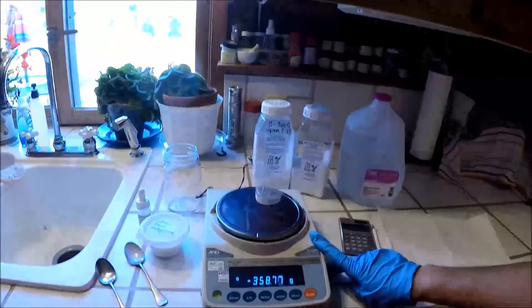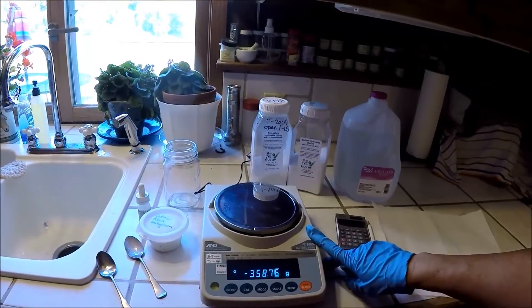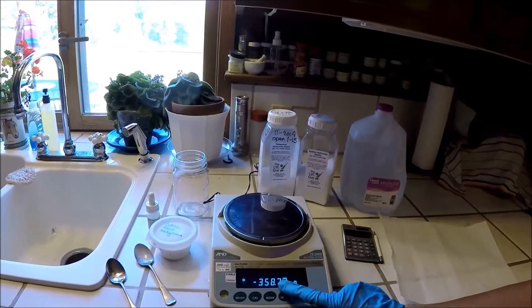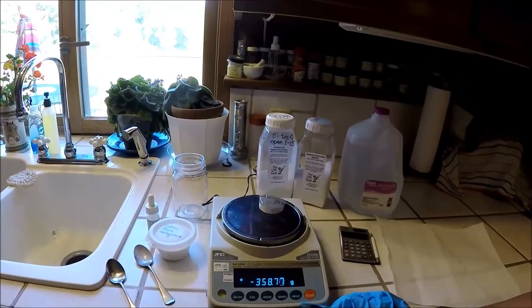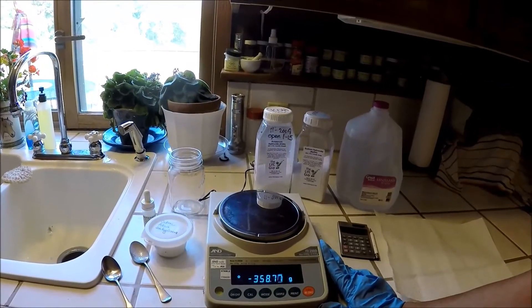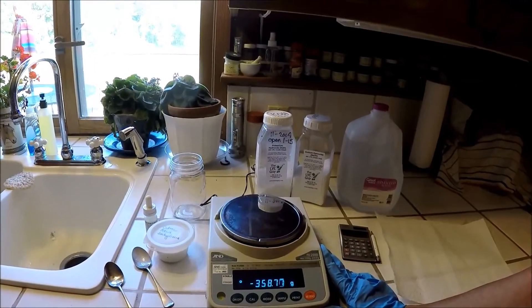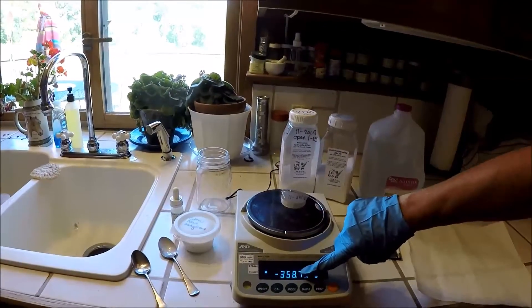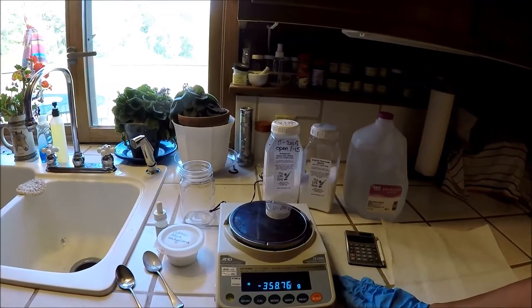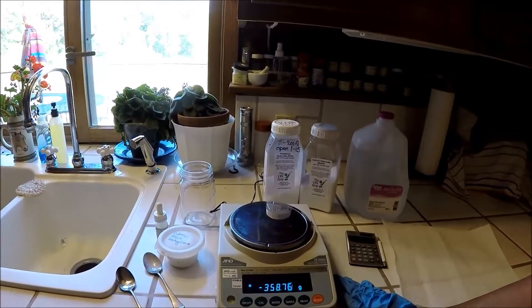You're going to need a decent scale. Mine's a secondhand lab scale, so it reads out to hundredths of a gram. If you only have a scale that reads out to tenths of a gram, that will probably be accurate enough. But if you have a scale that only reads to whole grams — just 358 instead of 358.7 — then you're going to want to get a more accurate scale, or just accept the fact that you're going to get just a rough idea of your purity.